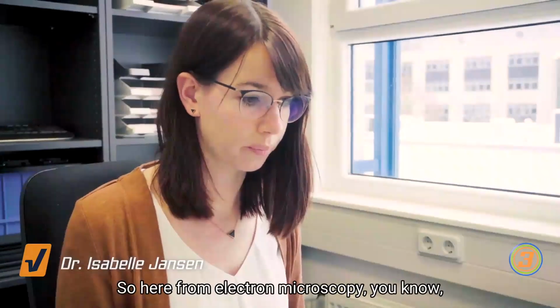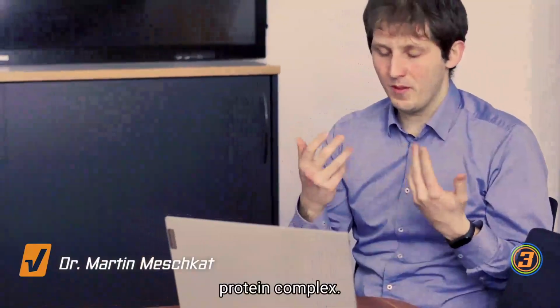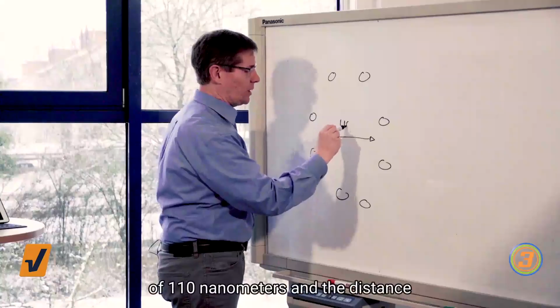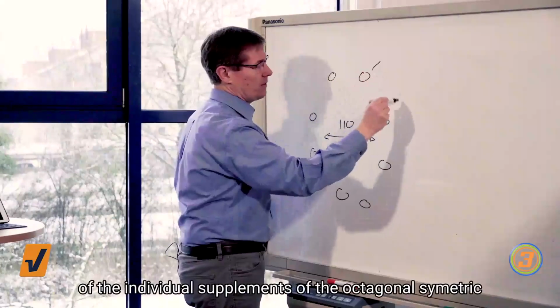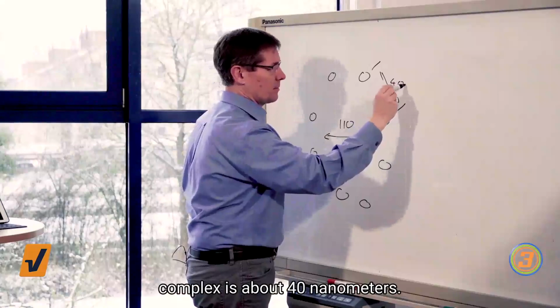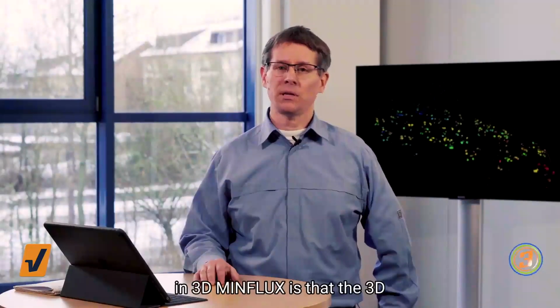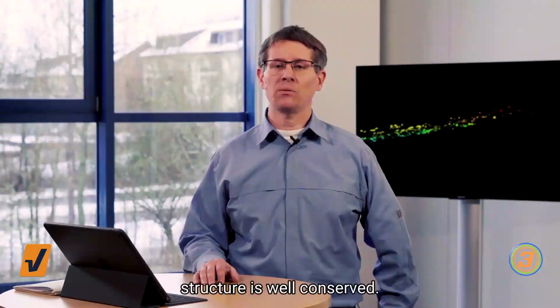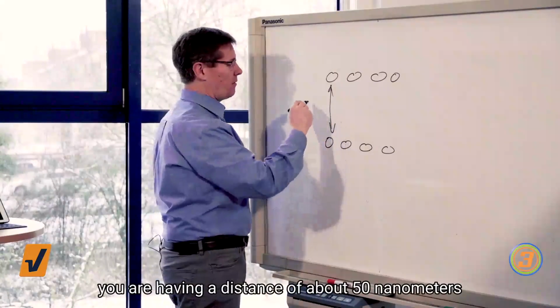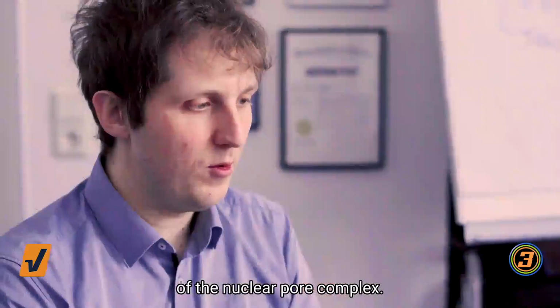So here, from electron microscopy, you know what is the size and the distances within this protein complex. The diameter of the complete complex is in the range of 110 nanometers, and the distance of the individual subunits of the octameric complex is about 40 nanometers. One of the largest advantages for trying it out in 3D MINFLUX is that the 3D structure is well conserved. So here you know very well that you're having a distance of about 50 nanometers between the upper and the lower plane of the nuclear pore complex.